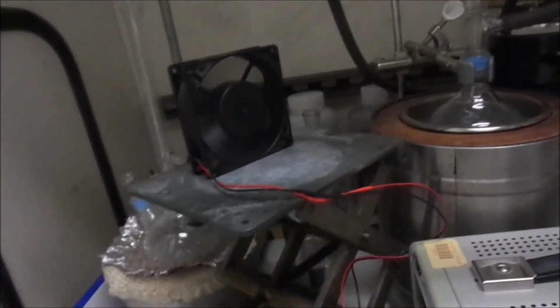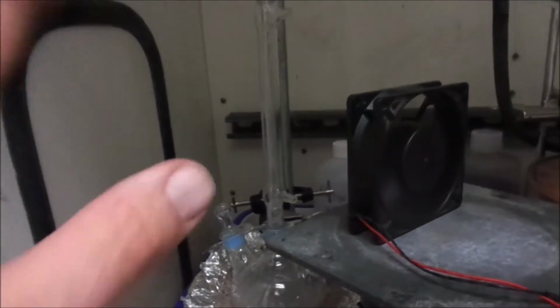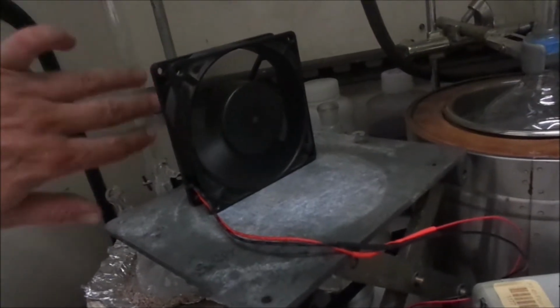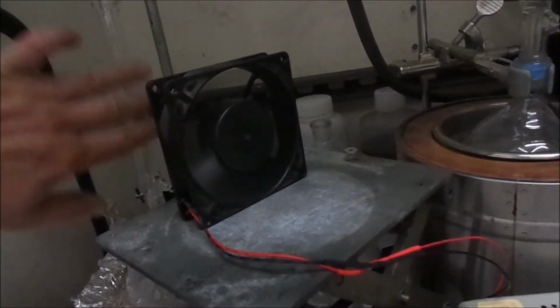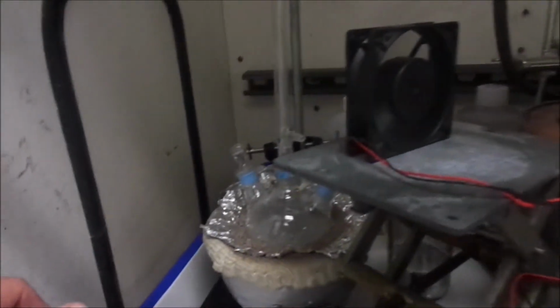I think that this will. I think we got it, because it was too much with the water and it wasn't quite enough without anything on it. This thing's warm, but it's nothing like it was. I can actually put my hands on it now, so I think this will work out well. This is working really well with the fan here. Condensation is building all through the distillation tower. That's what we want. And we're getting some drop out.